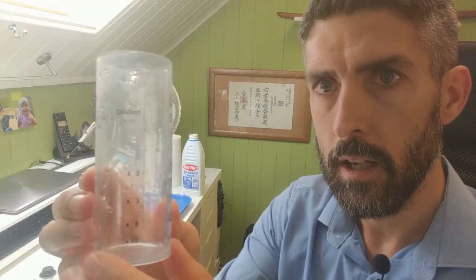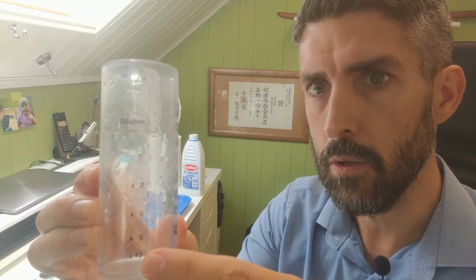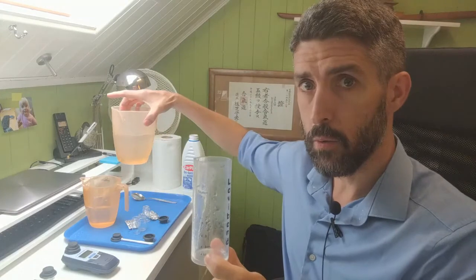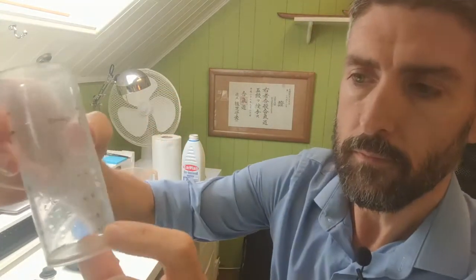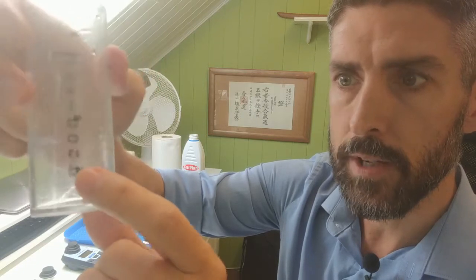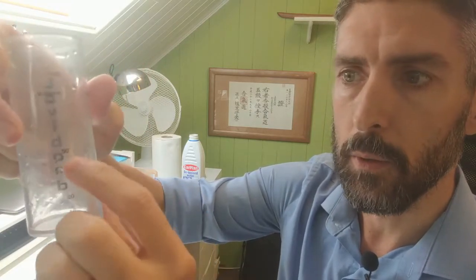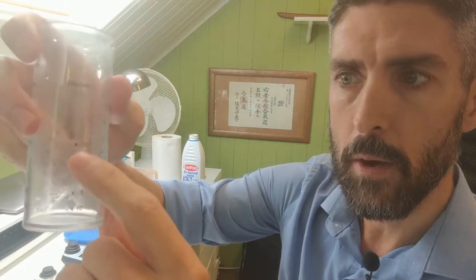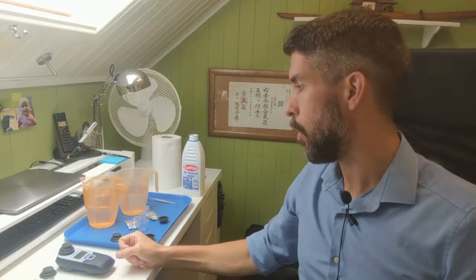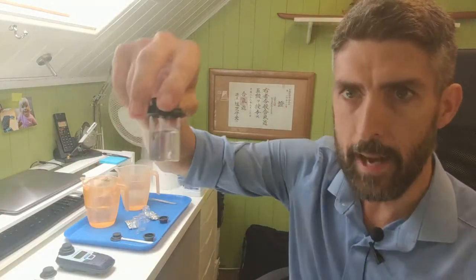Now on the side of the beaker it's got this dilution factor. That's how much you need to multiply that result by to find out how much chlorine is in that water. So because we used 10 ml, we need to multiply it by 10. Obviously if you were diluting up to 20 ml, then you'd be multiplying by 5. If you were diluting up to only 50 ml, then you'd only multiply by 2, but we need to times by 10. So that means there's basically 40 parts per million in that water, which made the DPD tablet go that colour.